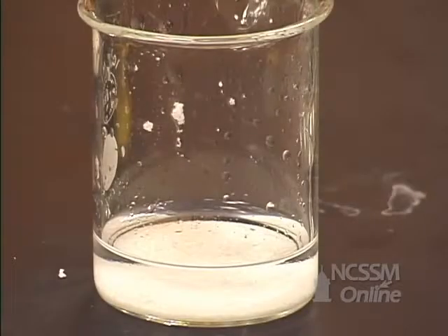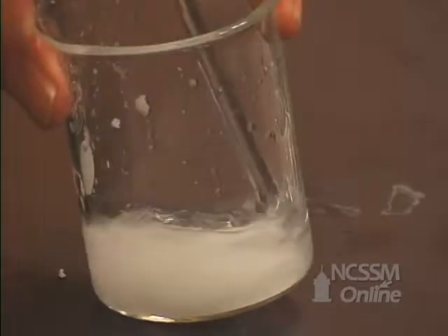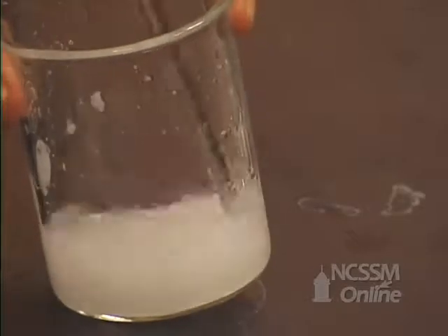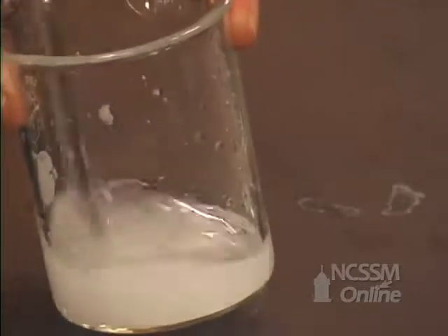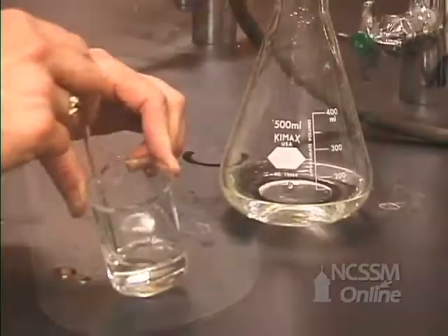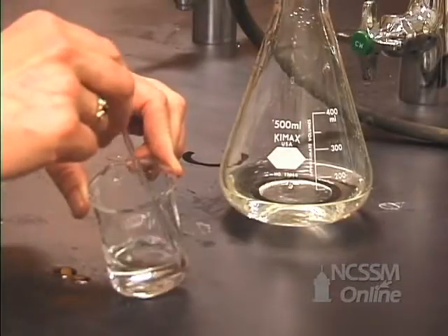Now we want to dissolve our aspirin in the alcohol so that we can recrystallize. Recrystallizing will allow us to get larger crystals of the acetylsalicylic acid.